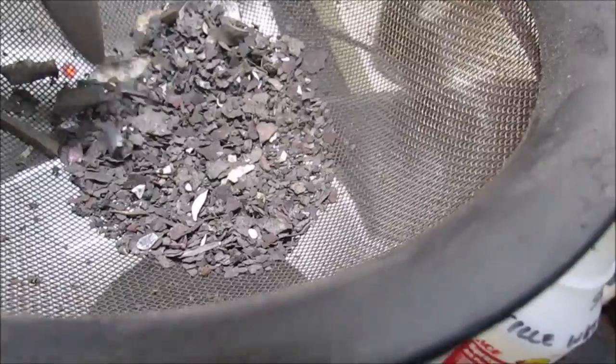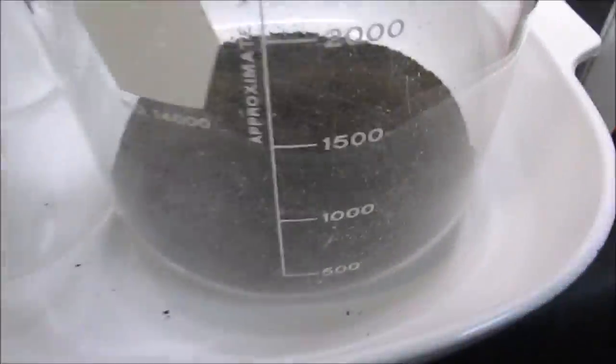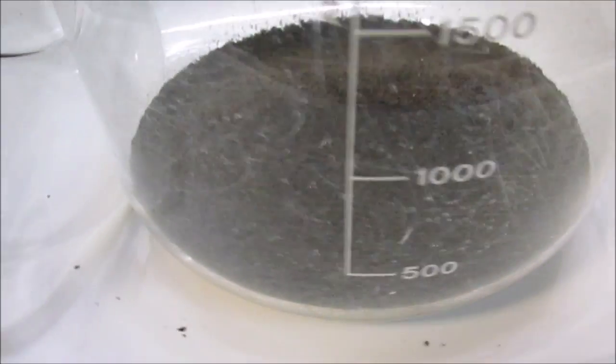A piece of glass, a piece of corning ware. So we've got everything now down into the bottom of our beaker here and we'll go from here.